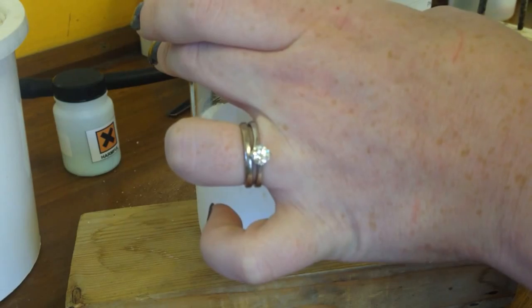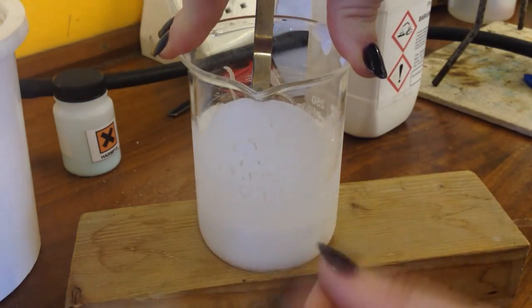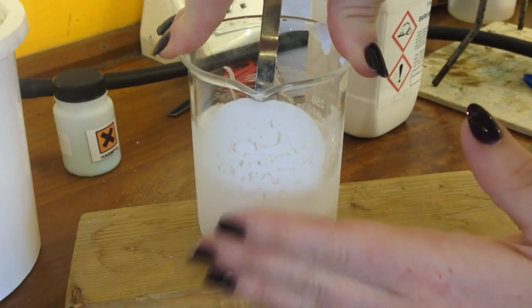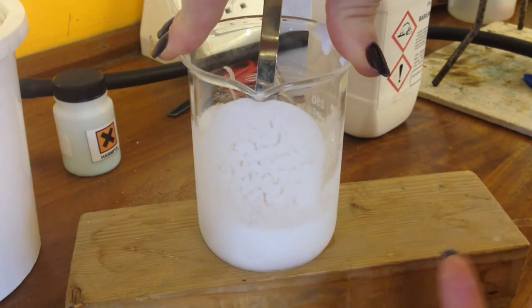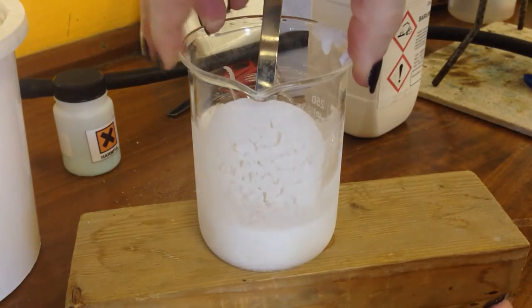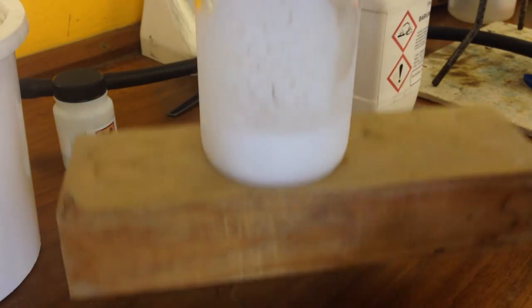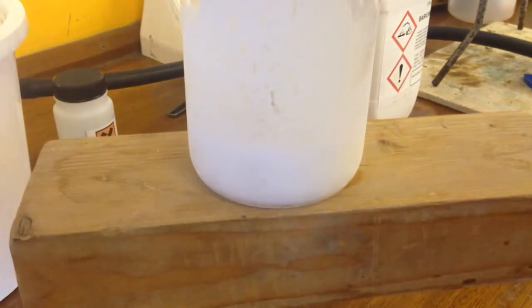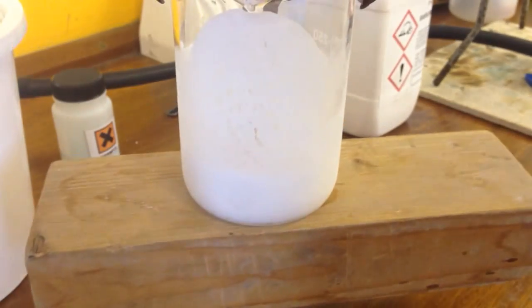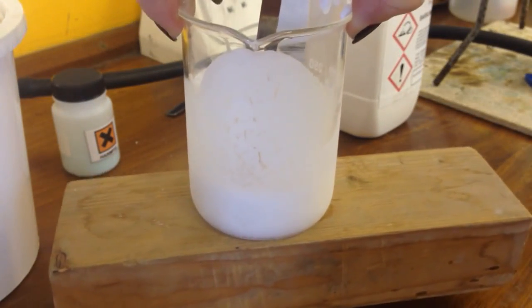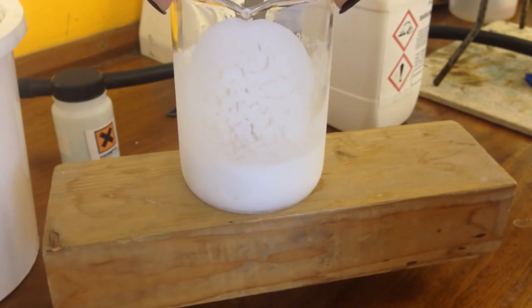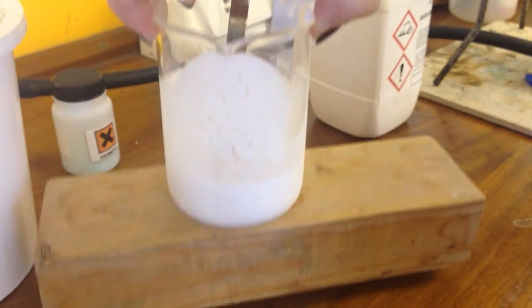So this reaction actually drops down to about minus 30 and it's really hard for me to touch here because it really does feel very, very cold. And ta-da! I'm able to lift up the block of wood using the beaker because the reaction's got so cold it's frozen the wood to the beaker.